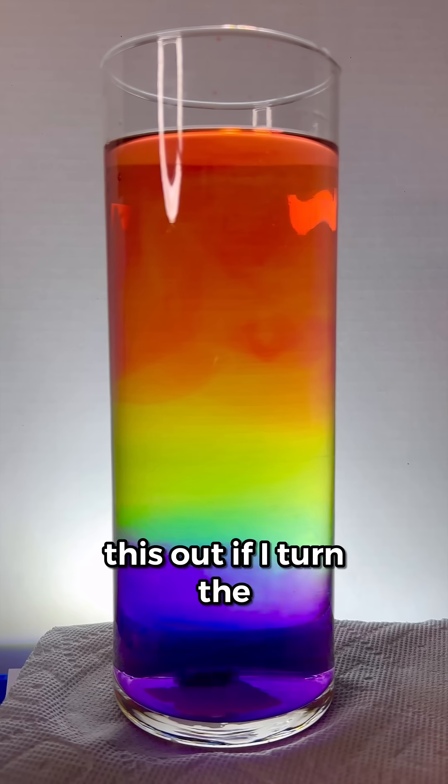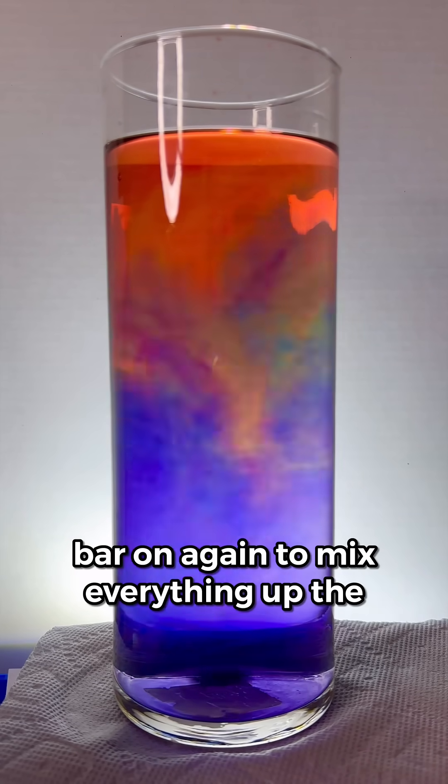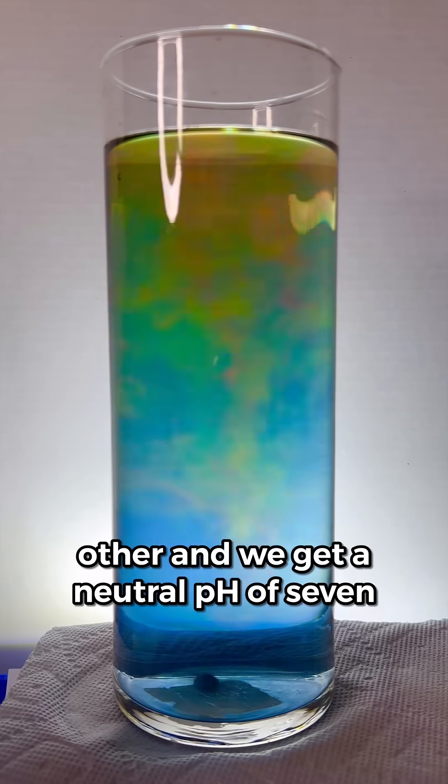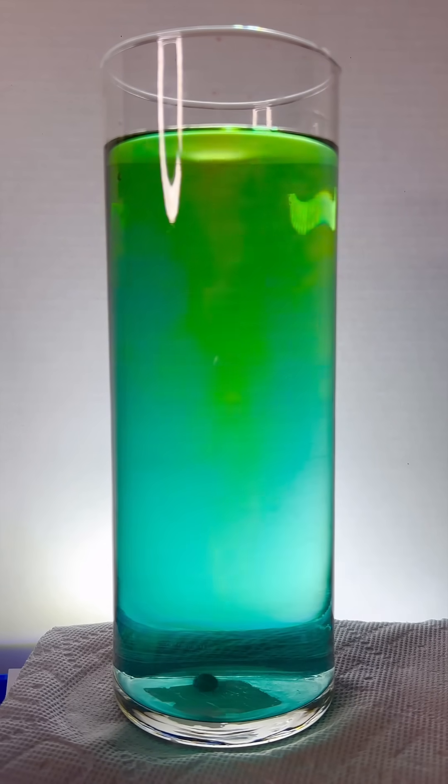And check this out. If I turn the stir bar on again to mix everything up, the acid and base neutralize each other, and we get a neutral pH of 7, a green color.